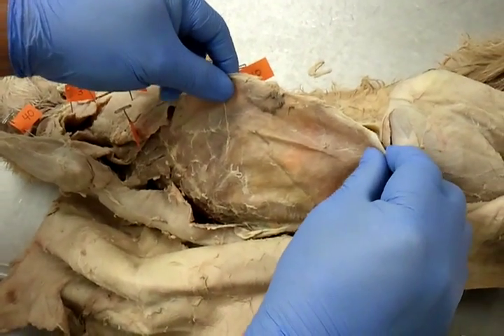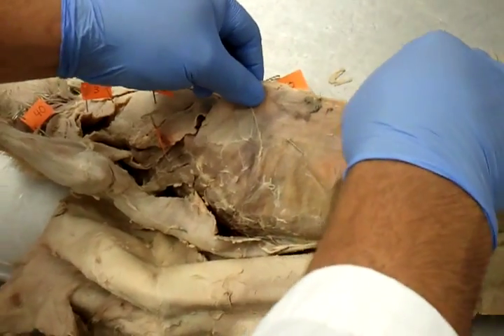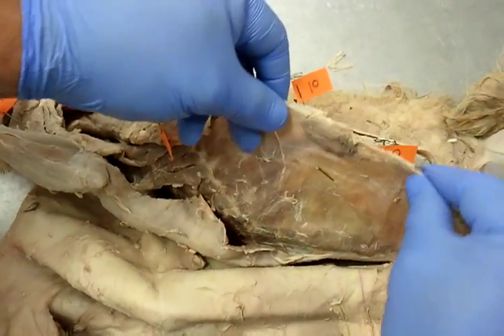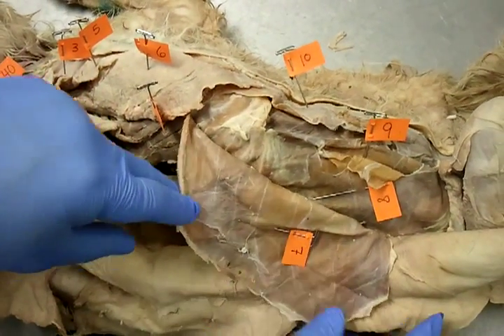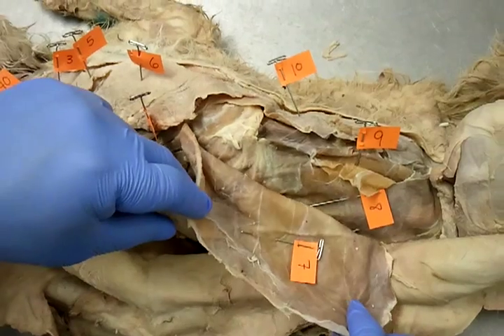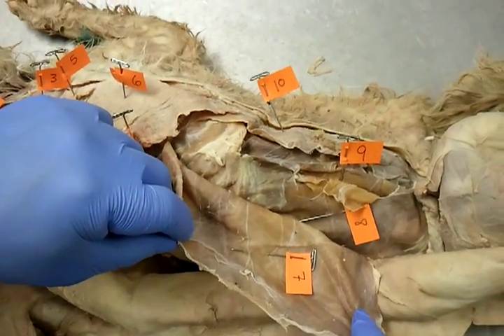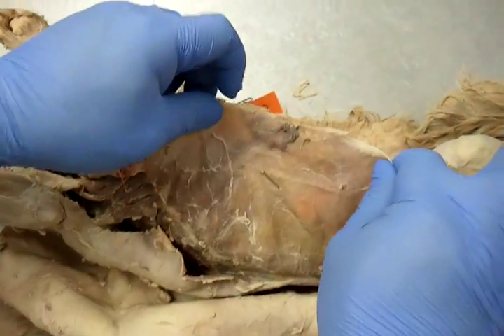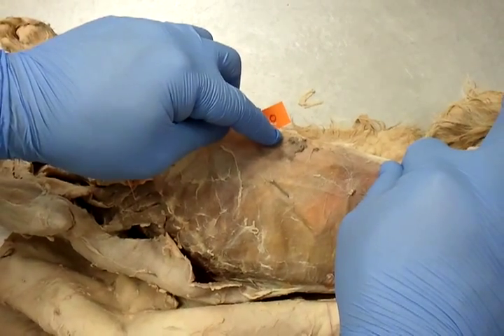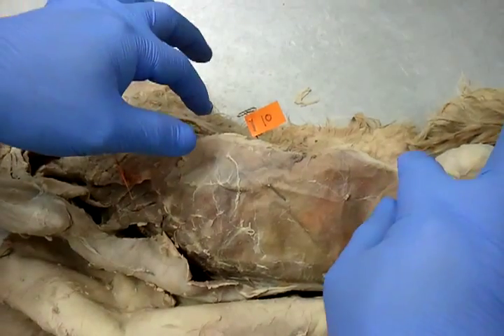Number seven is external oblique — it covers everything. We're waiting on Kim. Move your one finger for a second; that's your external oblique.